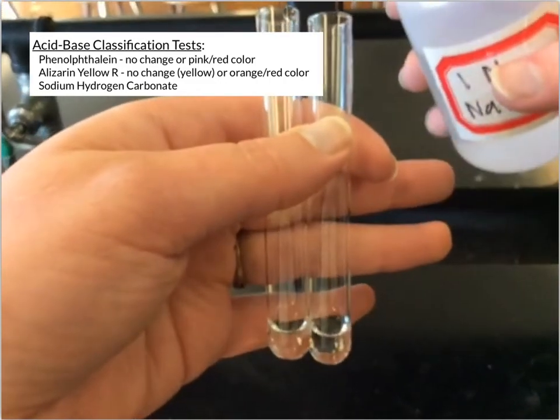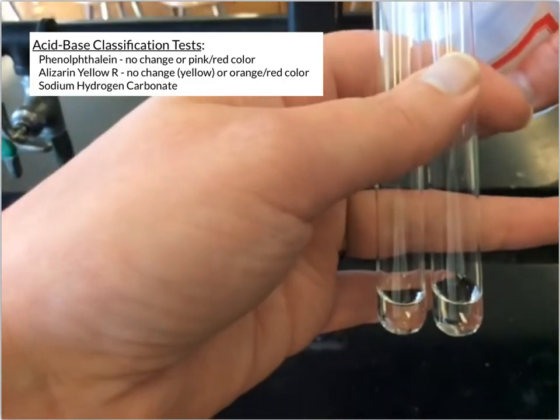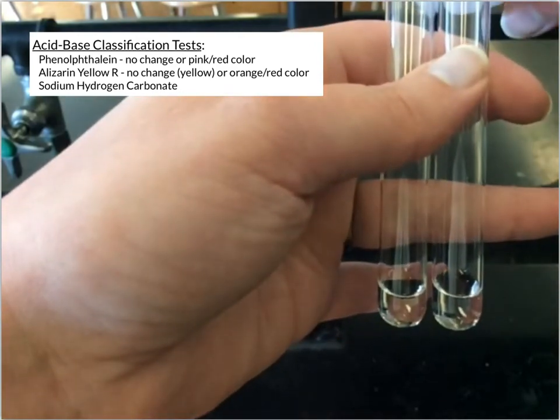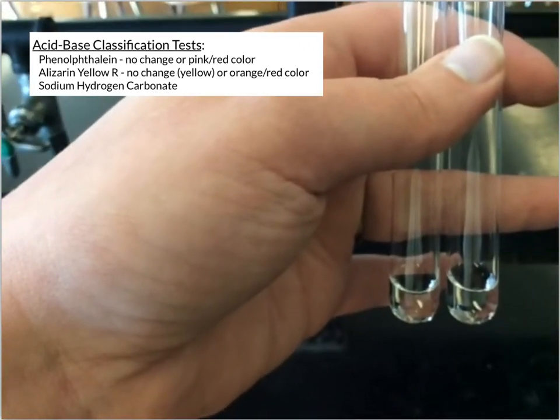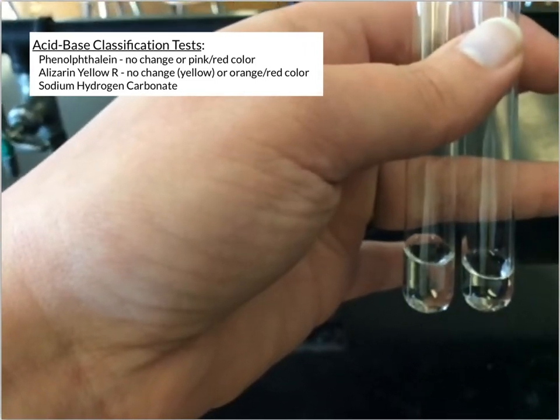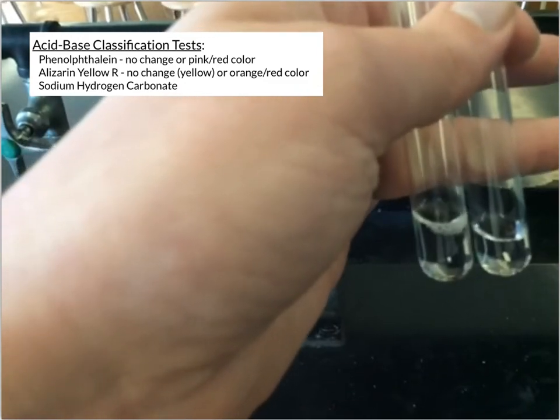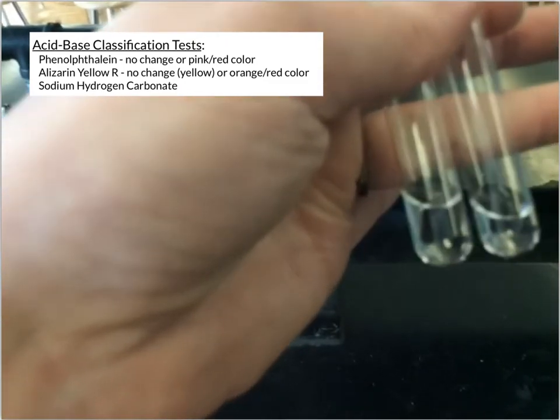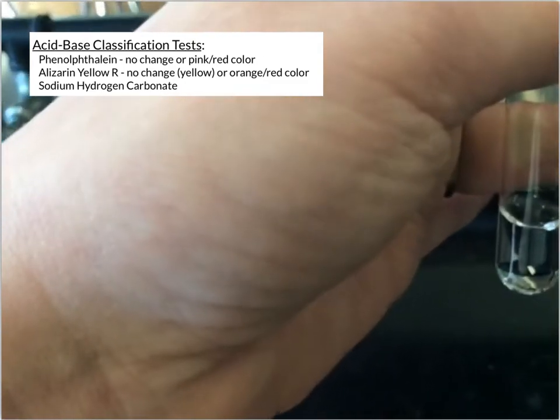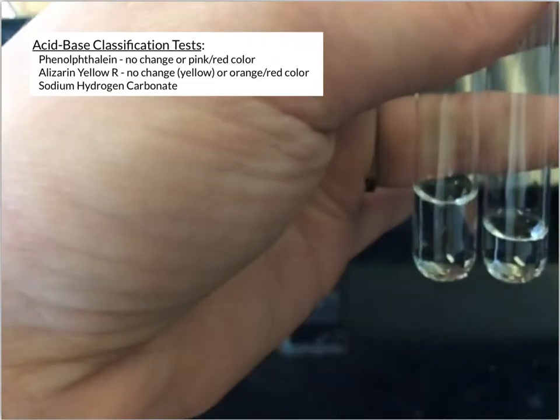So I'm going to add a few drops. Now I'll do 1 tube at a time slowly. So this first tube on the left, I'm adding that, and you can see as I'm adding it, there's bubbles forming. And even when I shake it, some more bubbles form. And so that's what we're looking for, what we would call a positive test.